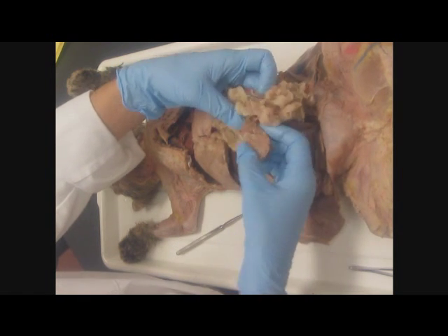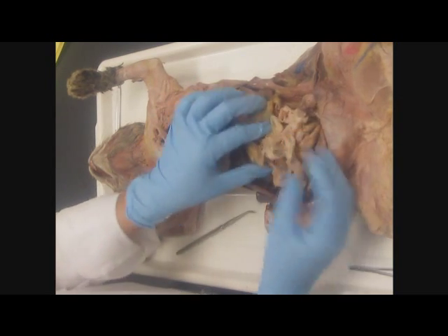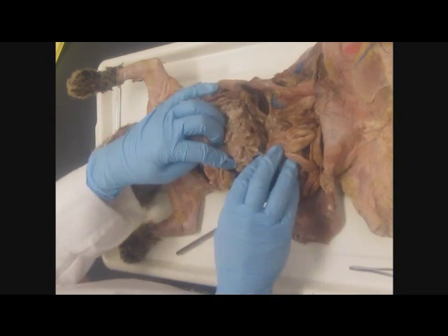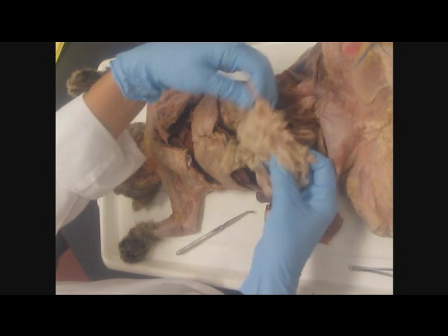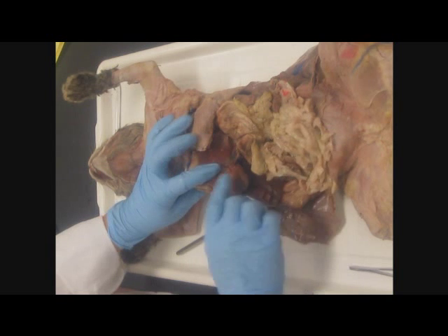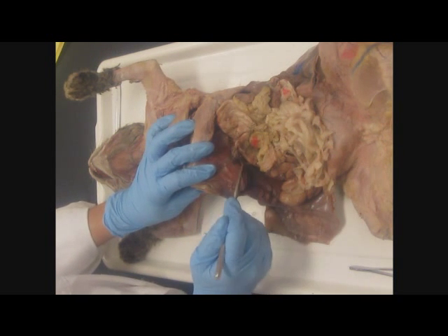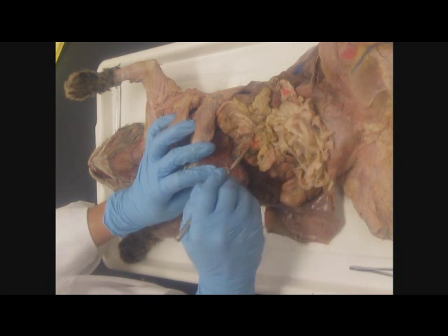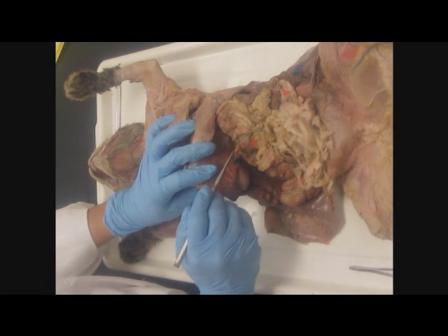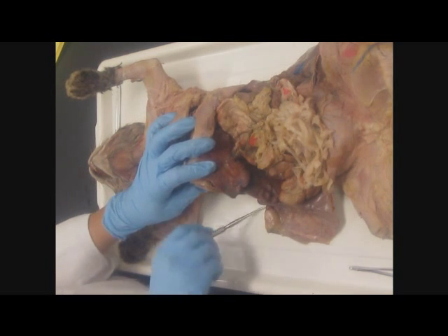And this is the one that is going to try to wrap itself in and around the organs, and if there's ever a puncture to the organs, it would seal that and help clot. Okay. The lesser omentum is between the liver and the stomach, and it's just this tiny bit of membrane in here between the stomach and the liver, right in here. Lesser omentum tethers those two organs together.